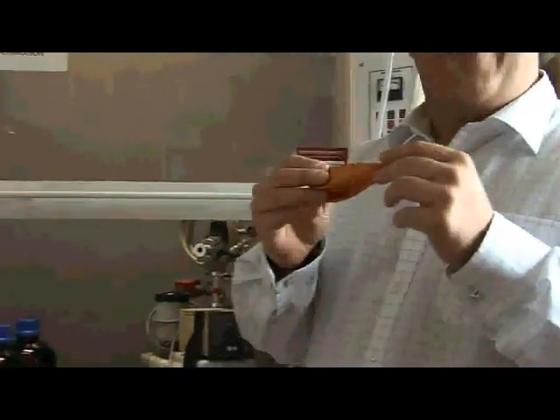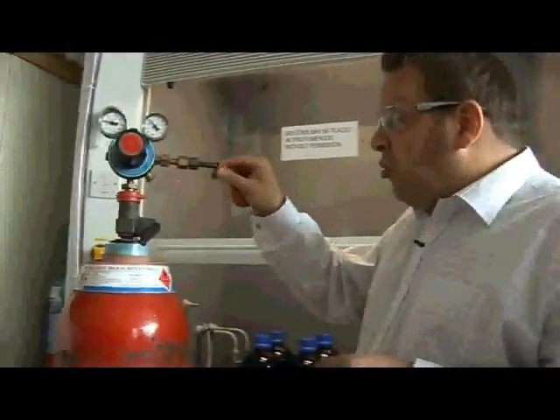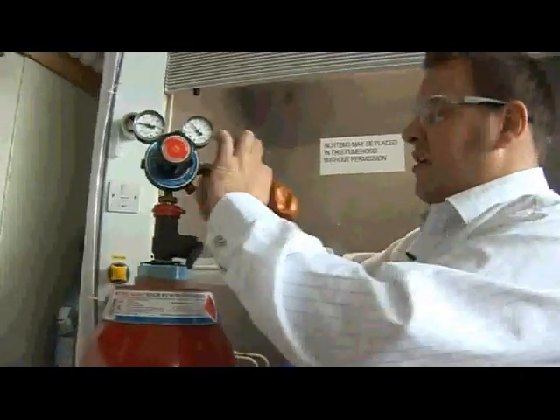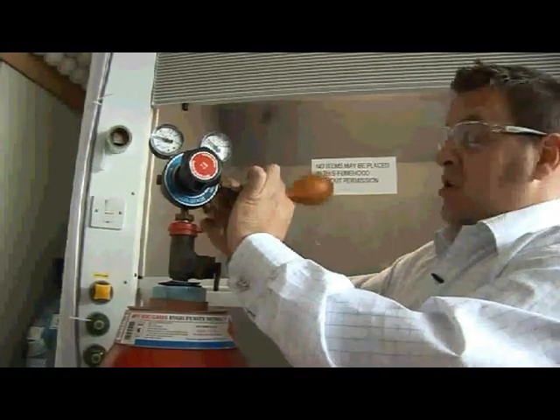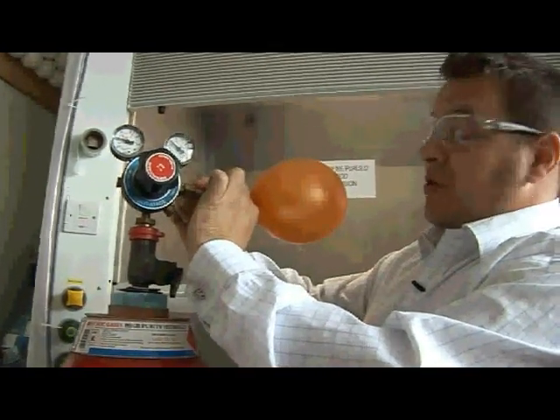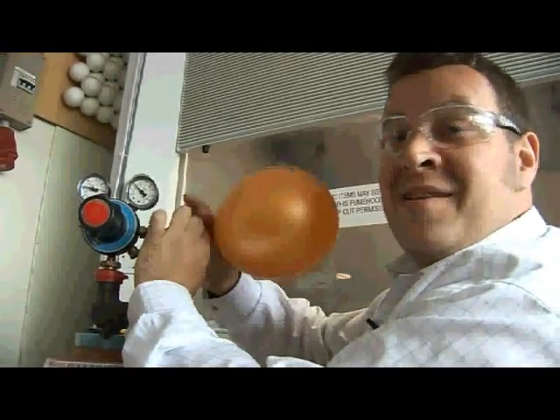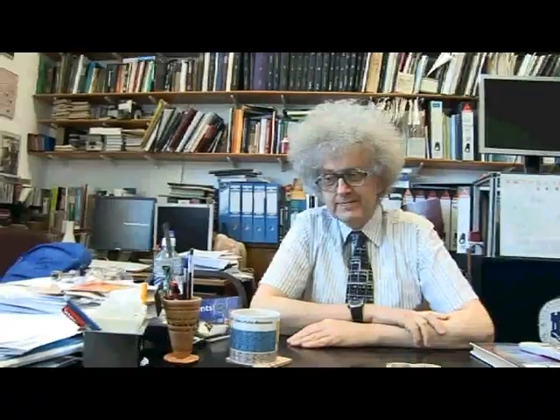So here's our little Hindenburg — a nice shiny balloon with a very, very flammable coating. We're just going to pop it onto the cylinder here and fill it up with a blast of hydrogen. You can probably hear it hissing and fizzing into the bottle there.